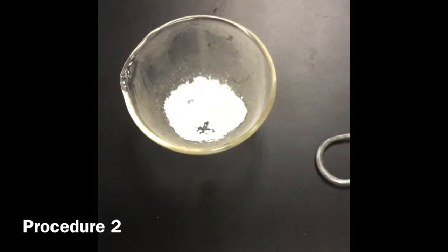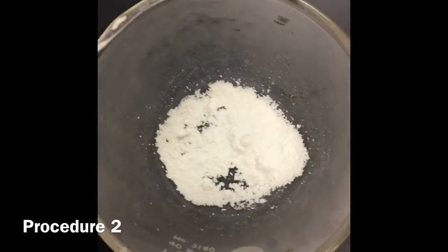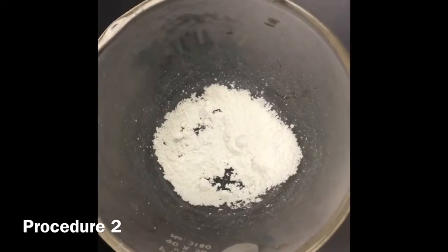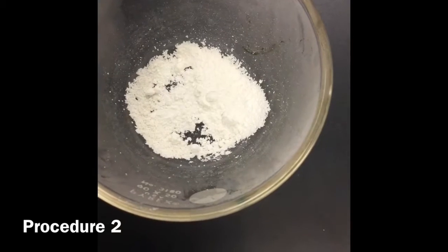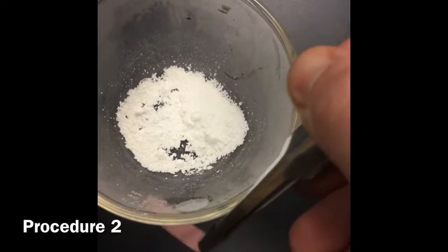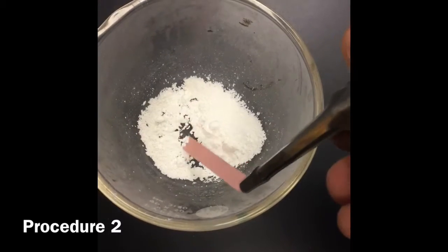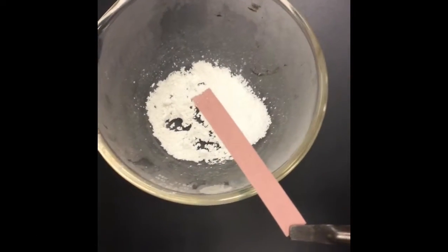So for procedure 2, we have a sample of calcium oxide, which is just like a white powder. And we want to take litmus paper and test this dry white powder to start off the procedure. We want to make sure it's not an acid or a base to start. So here's my red litmus paper. And there was no color change.